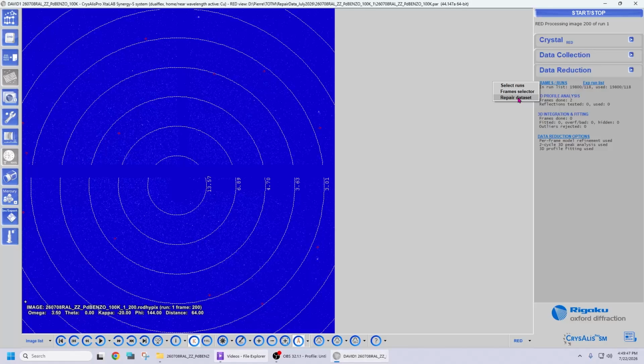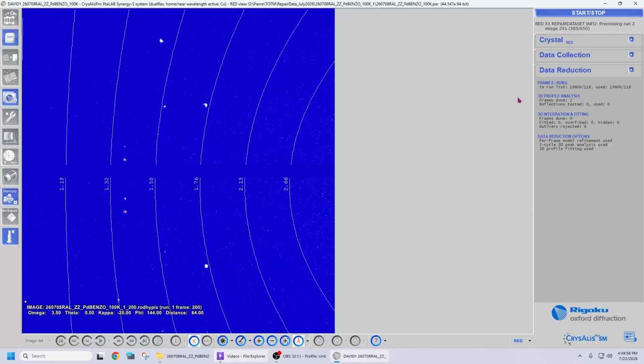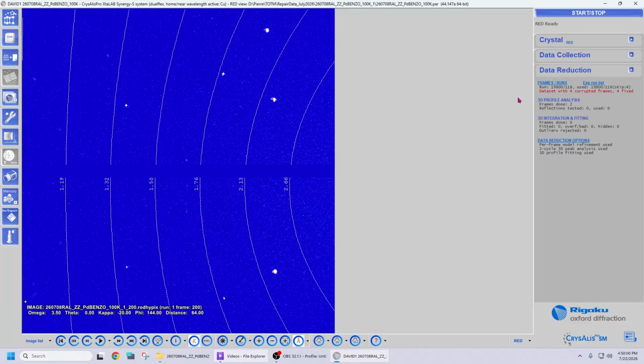And you'll see that as soon as I select this option, CrysAlisᴾʳᵒ will go through all the images and repair only those that need to be repaired. So here we go. It's done. CrysAlisᴾʳᵒ went through all the images of these 2 scans that I had kept, and now I should be able to handle those images as usual.